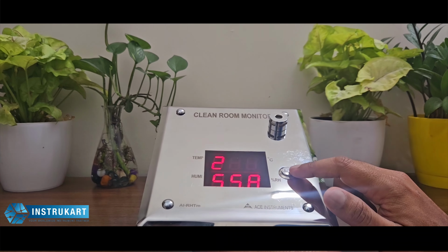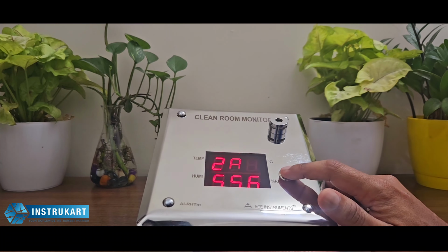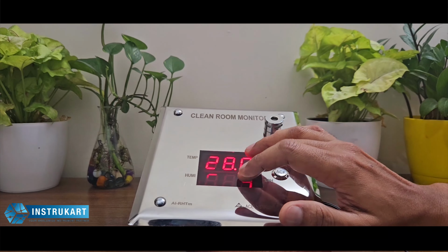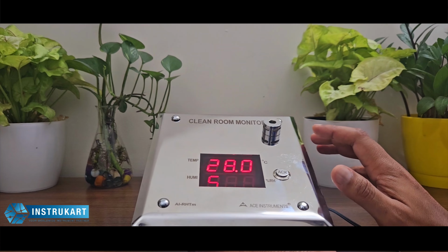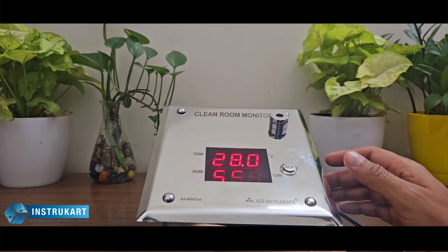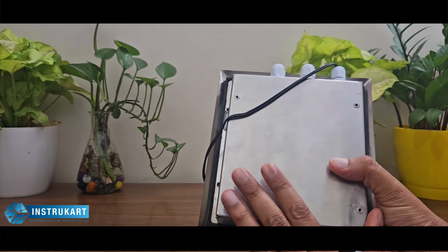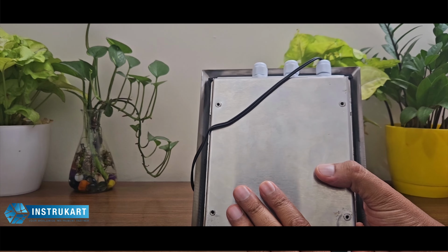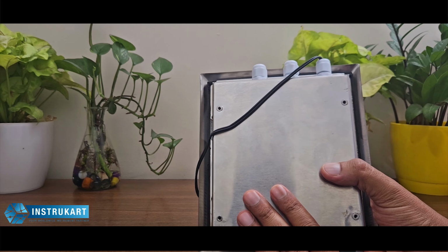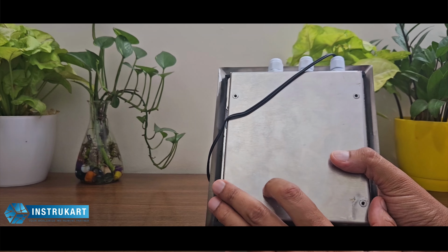A button which means acknowledgement, that means it is a manual intervention or the manual acknowledgement button just in case the set point of temperature or humidity violates. So it has got a visual and audio alarm along with. At the back you can see this has also got a SS body. Since it's a need, it can also have a MS body at the back as a standard.